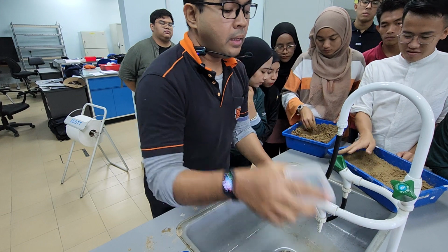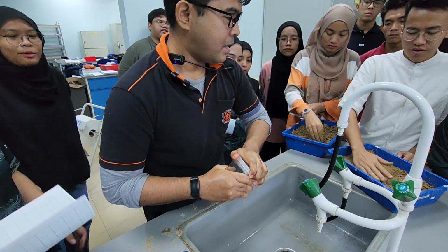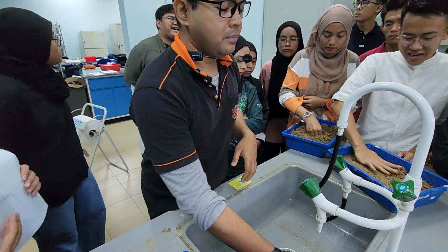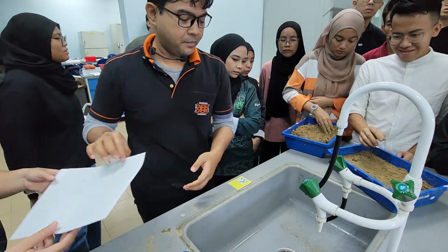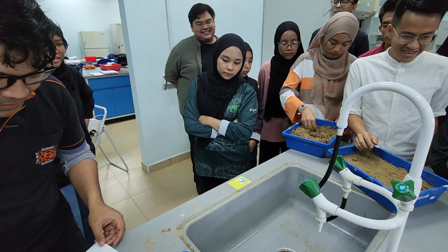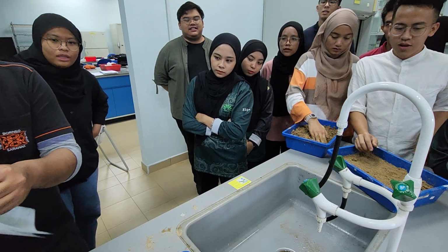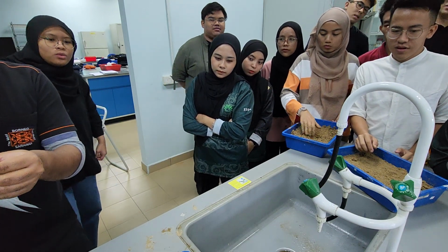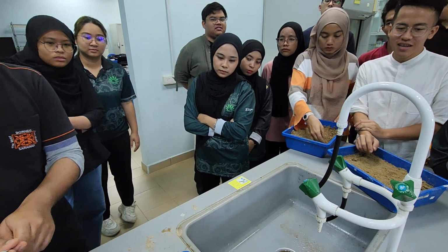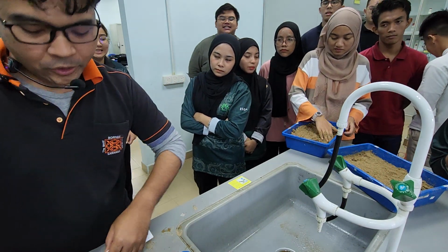Remember, okay, this thing. Why is it pink? Ada hormon. Ada hormon? Fungicide. Apa fungicide dia? Corn, what color is corn? Yellow. Is that yellow? No. Okay. Why is it not yellow? Because it's coated with fungicide. Fungicide. What's the name of the fungicide? Tiram. Thiram.